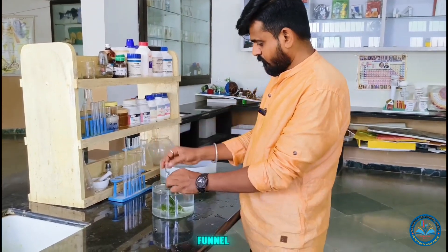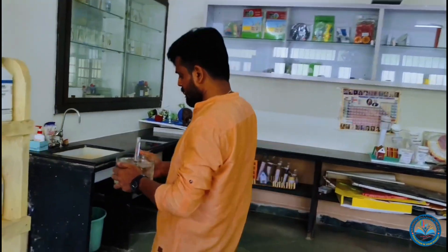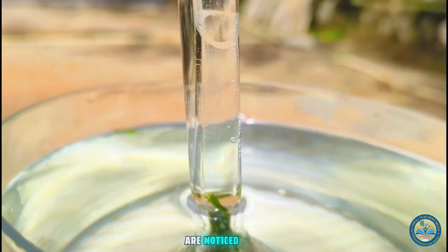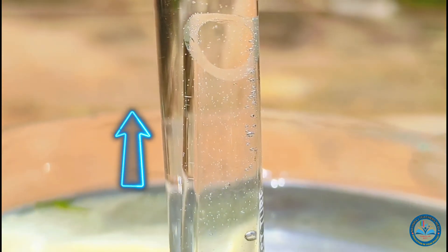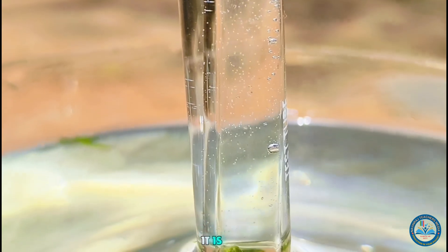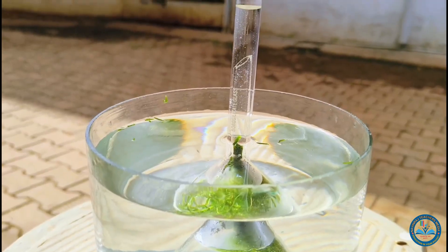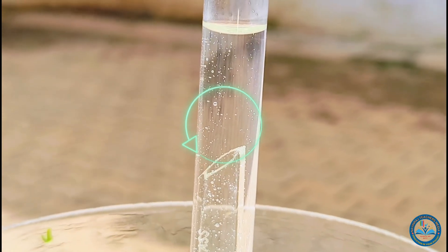Place this setup outdoors under sunlight. Third step: after a while, bubbles are noticed rising up from the plant and reaching the top of the inverted test tube. As the bubbles rise, the water level in the test tube comes down while the water level in the beaker rises.